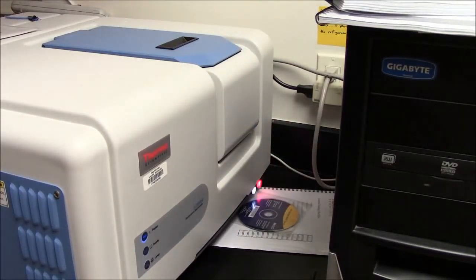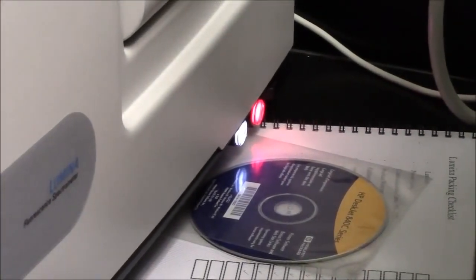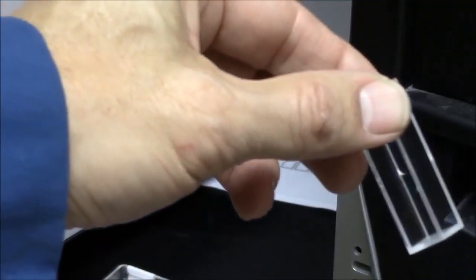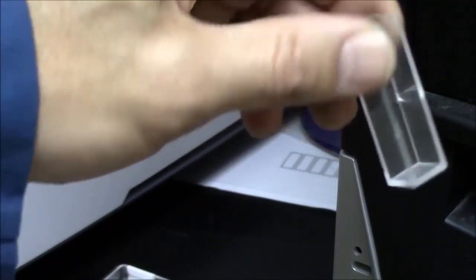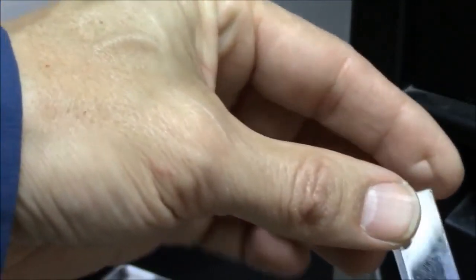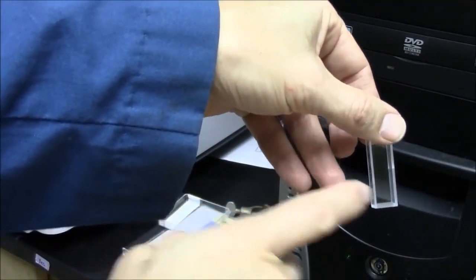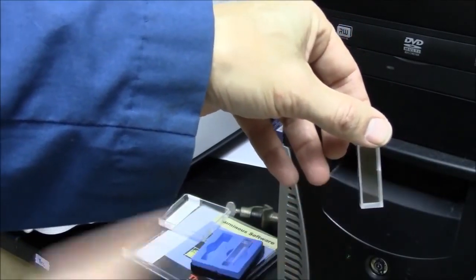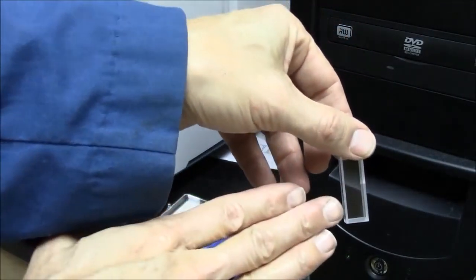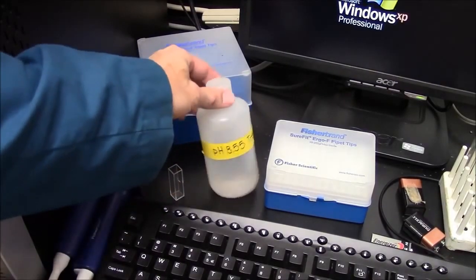So this is the correct starting sequence for the fluorimeter and must be done in this sequence so that you do not harm the machine. The fluorimeter uses cuvettes, similar in concept to those used in a UV spectrophotometer, but all 4 sides are clear in a fluorescence cuvette. Light comes in from the side and you measure the light output from the front face. Light in, light out.